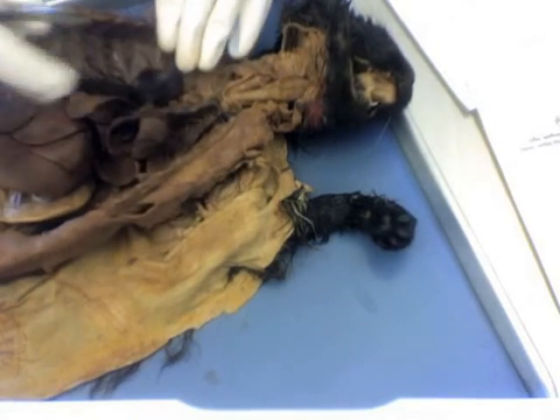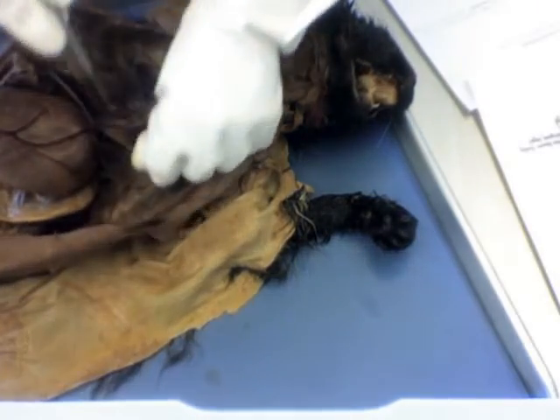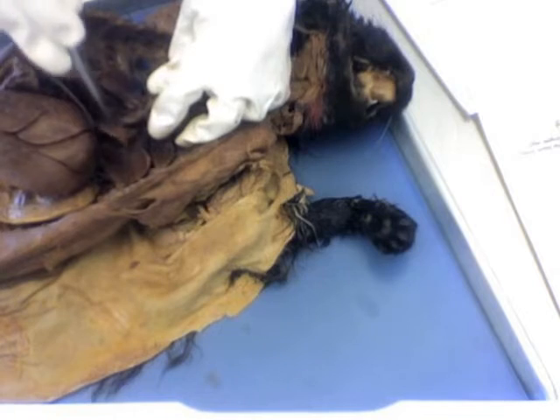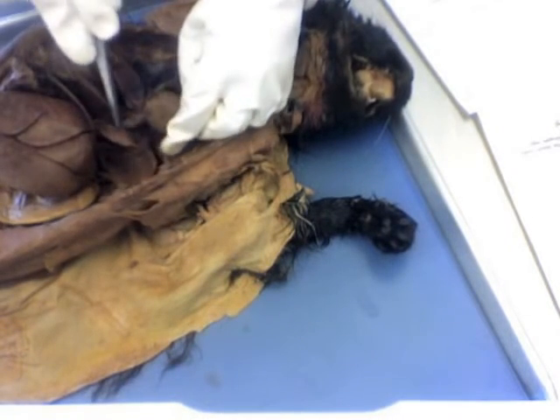The anterior and posterior vena cava, so our main vein, right here would be on the cat the anterior vena cava, and on humans it would be the superior vena cava. And then traveling downwards would on the cat be the posterior vena cava, and on humans the inferior vena cava.